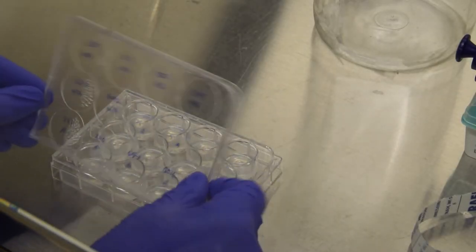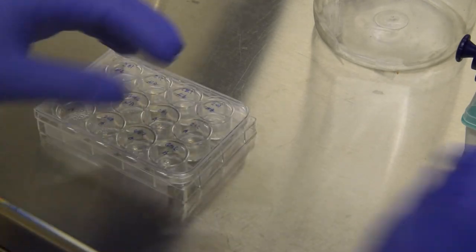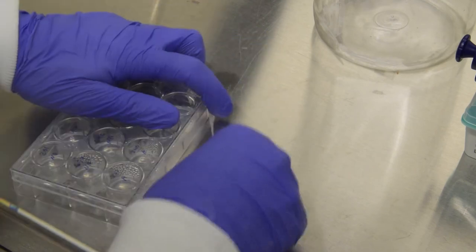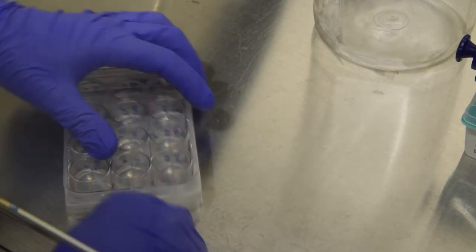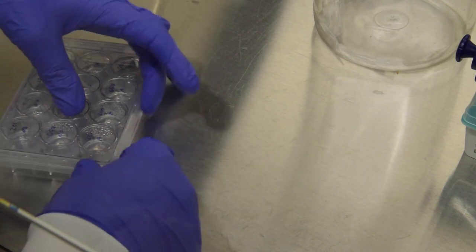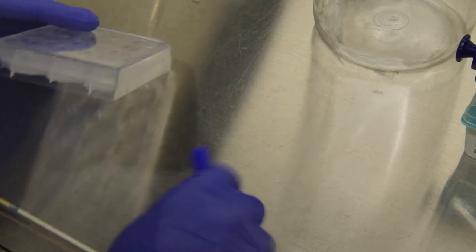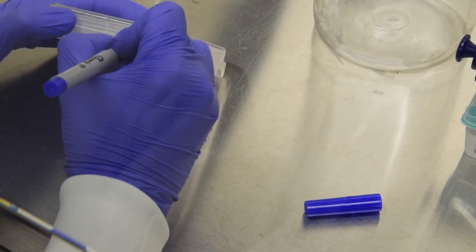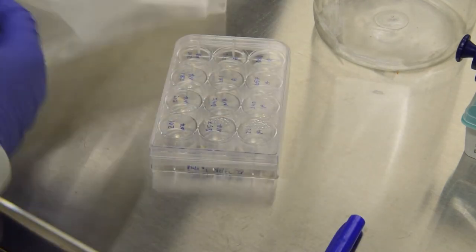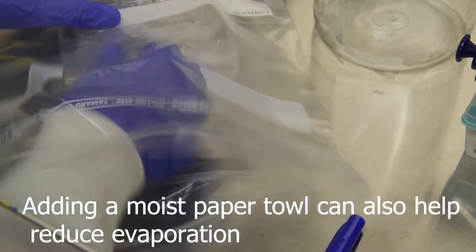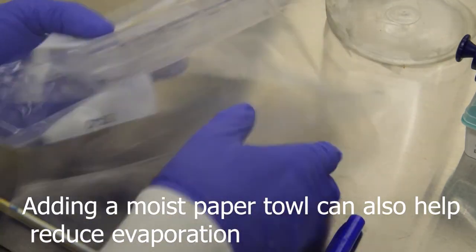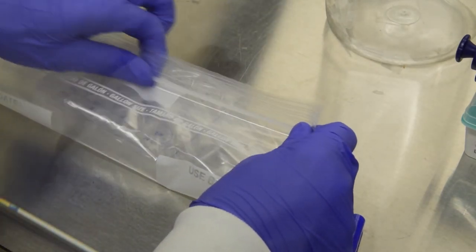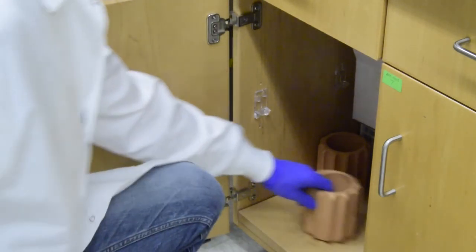Seal your plate with parafilm then label. Incubate the plate for 3 days at 24-26 degrees Celsius in a ziplock bag. This cabinet holds the correct temperature for this step.